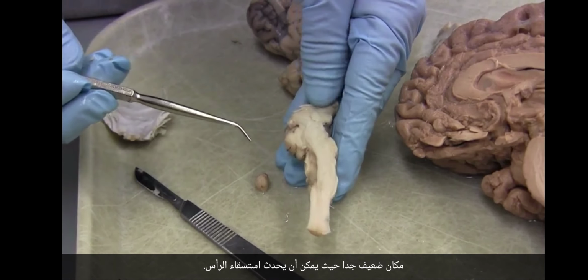If we look at it from the side, let's see, which side is this? Okay, we're going to look at it like this. So let's compare the sheep and the human. We don't have a human medulla, but here it is. Here's the medulla. Here's the spinal cord.